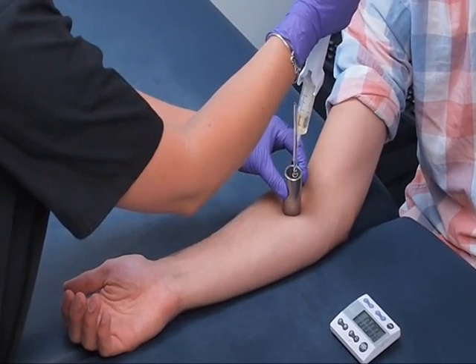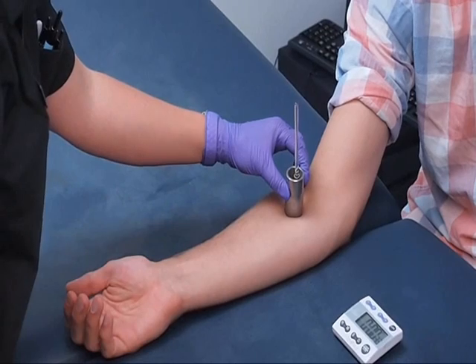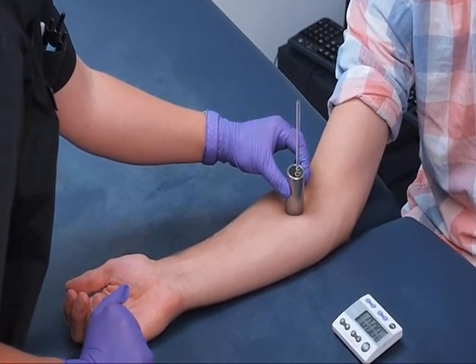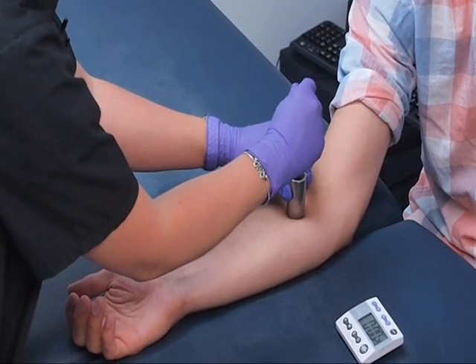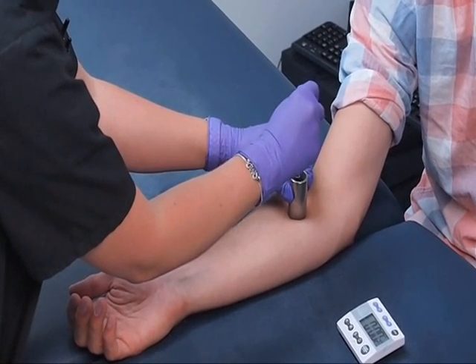Neutralizing sampling solution is dispensed into the same cylinder using a repeating pipetter with a sterile tip, and the skin area is again massaged for one minute using a sterile rubber policeman.